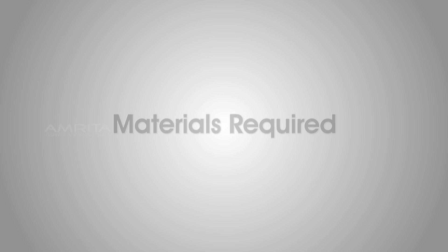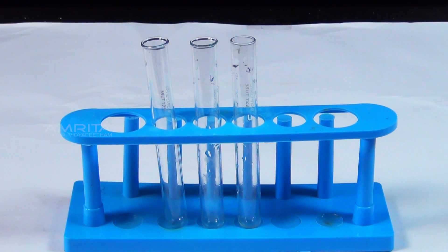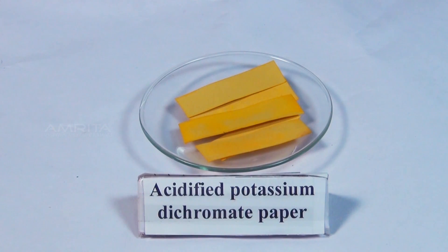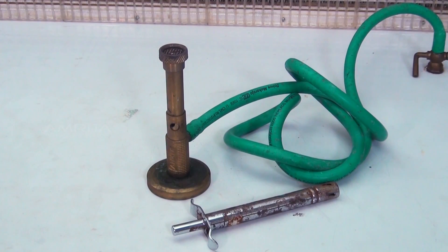Dry Heating Test. Materials Required: Original Salt, Test Tube, Acidified Potassium Dichromate Paper, Test Tube Holder, and Bunsen Burner.